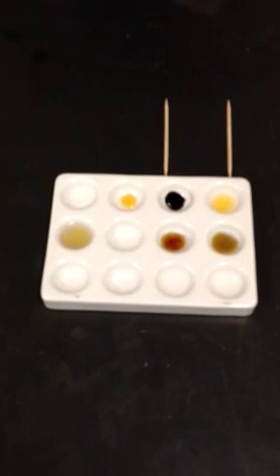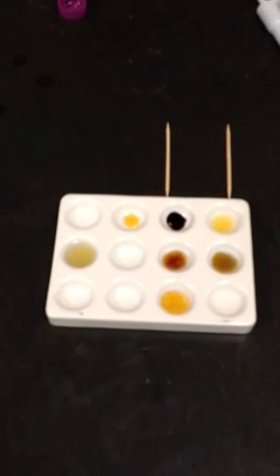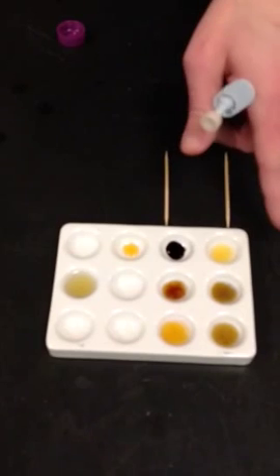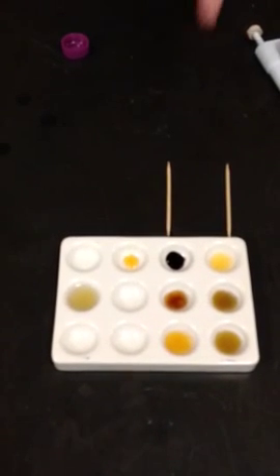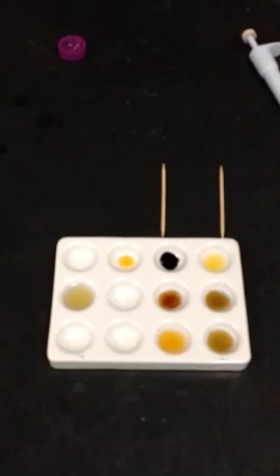One over here. Oh, I didn't put the right one. Silly me. There we go. Let's do this one here. With the iodine, it does work. So the one on this side here has been digested a little faster. Of course, I set it up first. This one is a little bit slower, but it's still in the process of digestion.